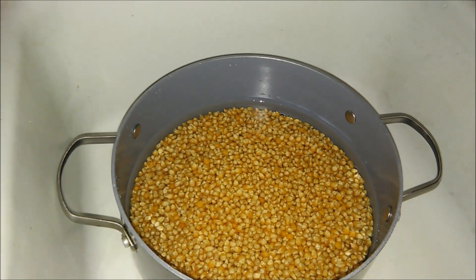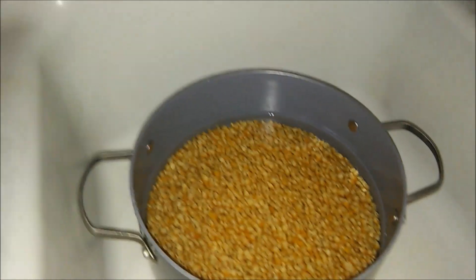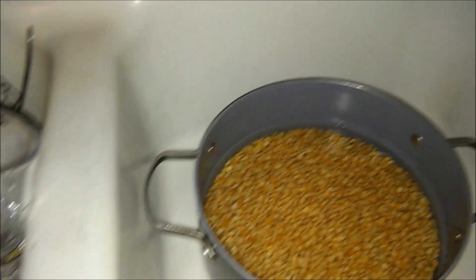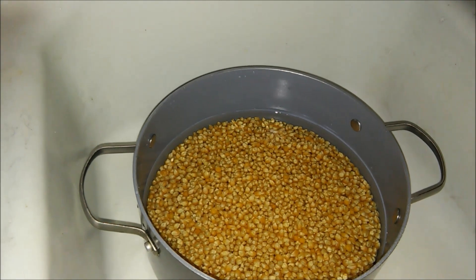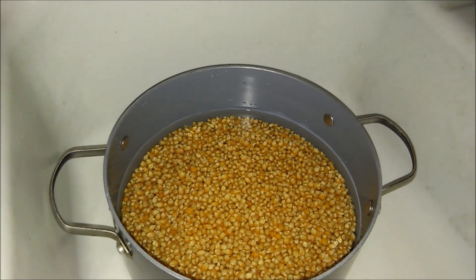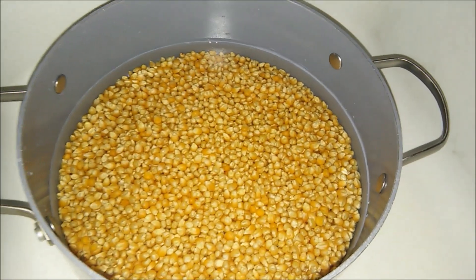You can use tap water if you want, or you can get distilled or spring water. We're going to let it sit overnight, and some of the chlorine will volatize. Then we're going to boil it, so some more will volatize. Then it's going to go in the pressure cooker. I've done this with tap water before and mycelium doesn't seem to mind.